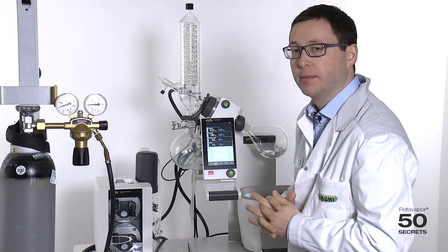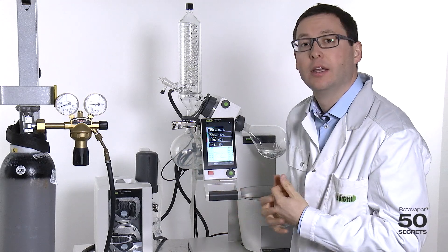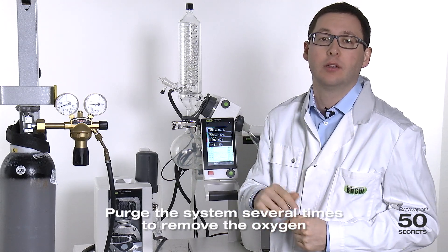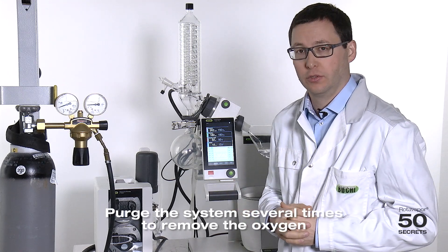Now, we have only a certain amount of oxygen in here. The rest is nitrogen already. This process we repeat two to three times in total.